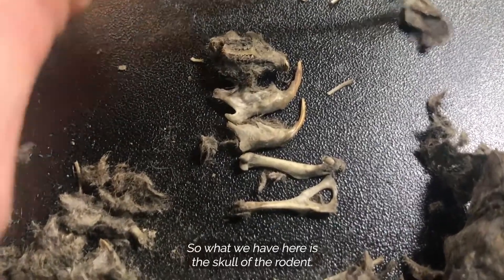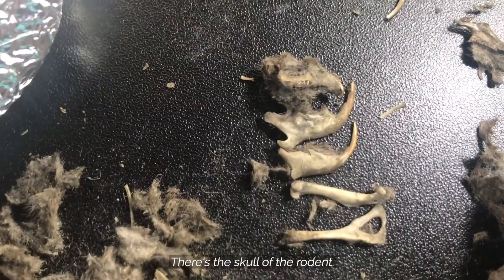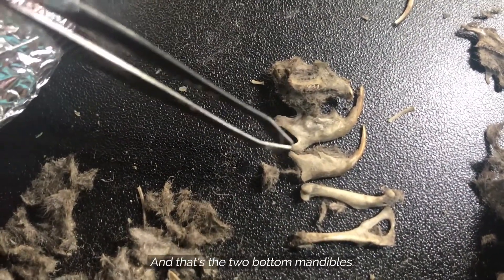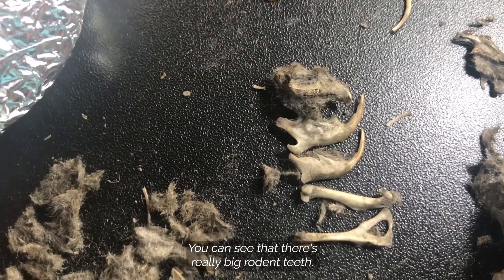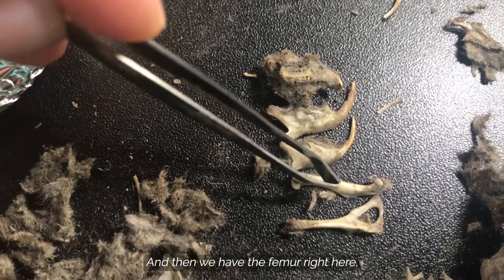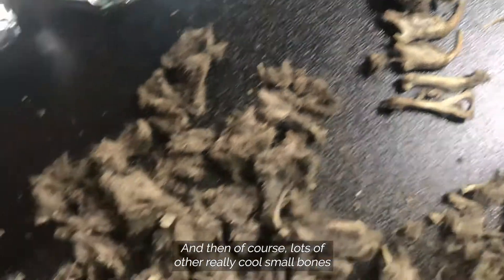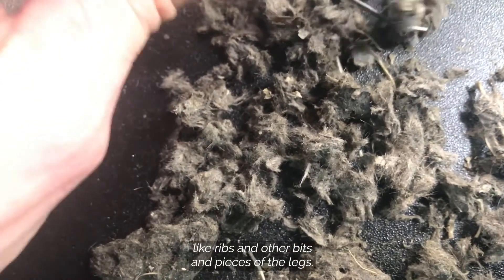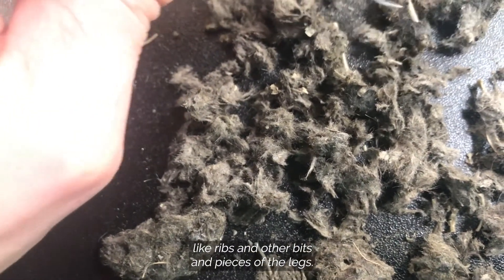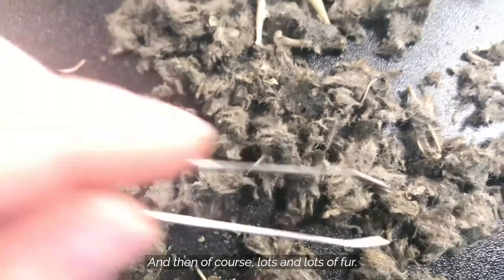What we have here is the skull of the rodent — here's the top of it and those are the two bottom mandibles. You can see those really big rodent teeth, and then we have the femur right here, a rodent scapula right there, and then lots of other really cool small bones like ribs and other bits and pieces of the legs, and of course lots and lots of fur.